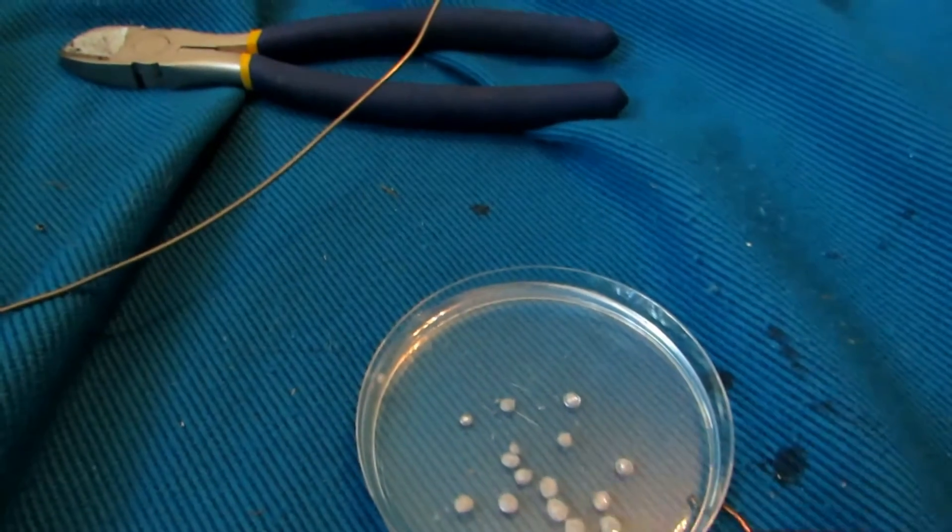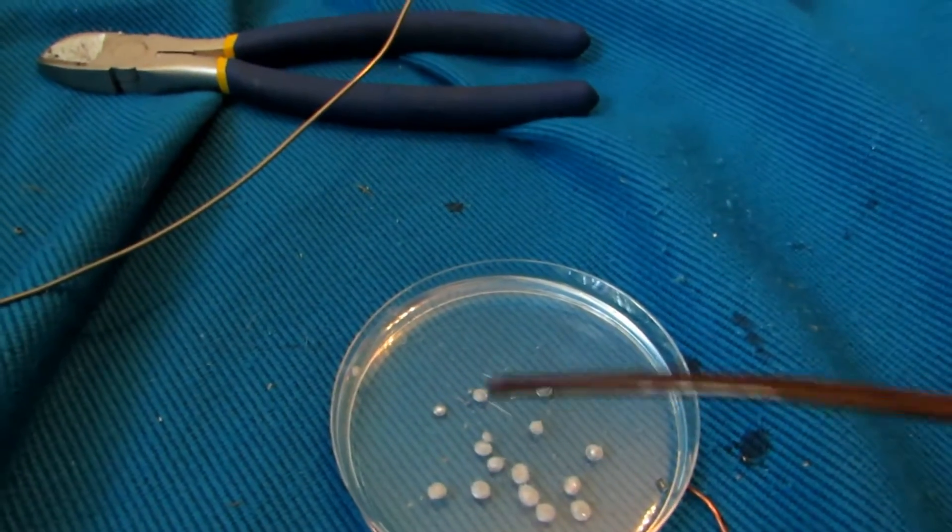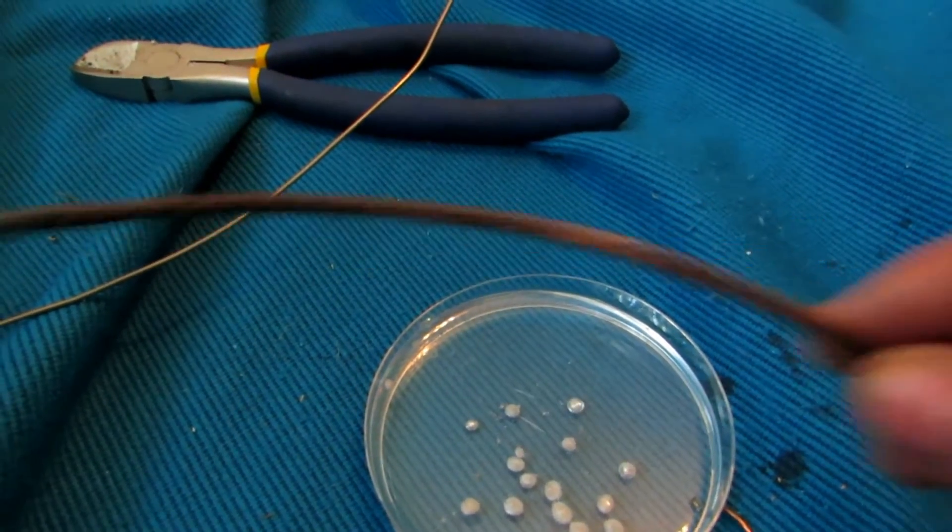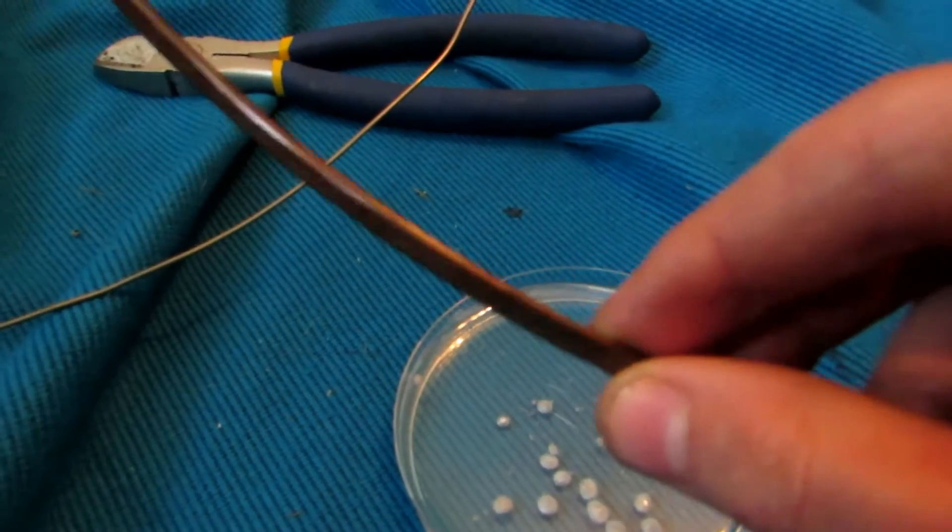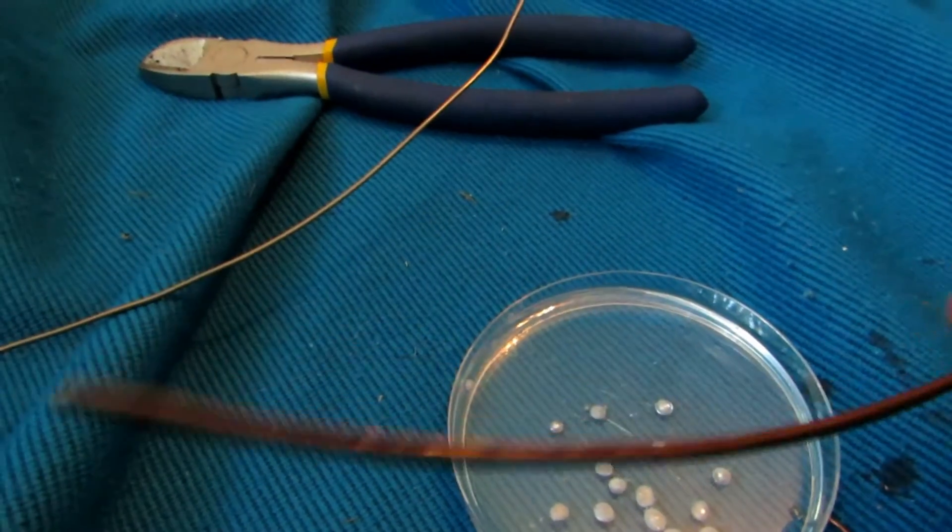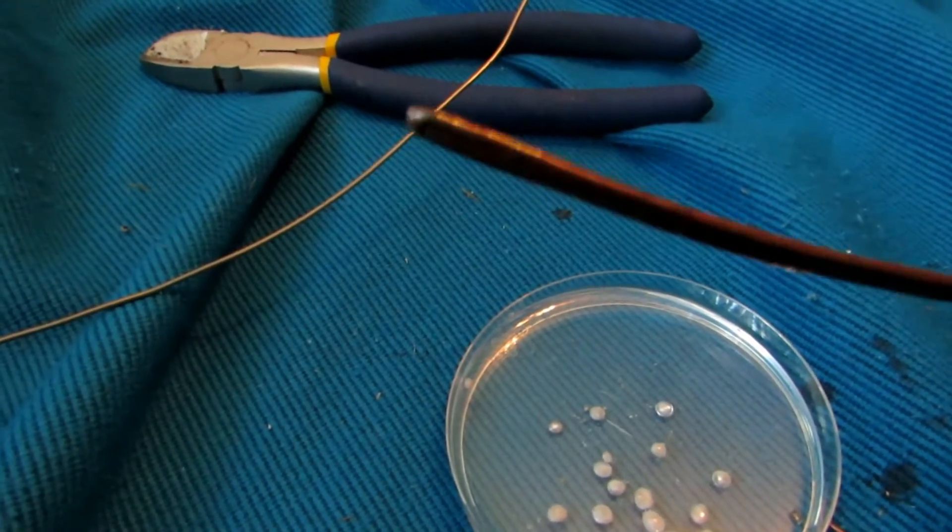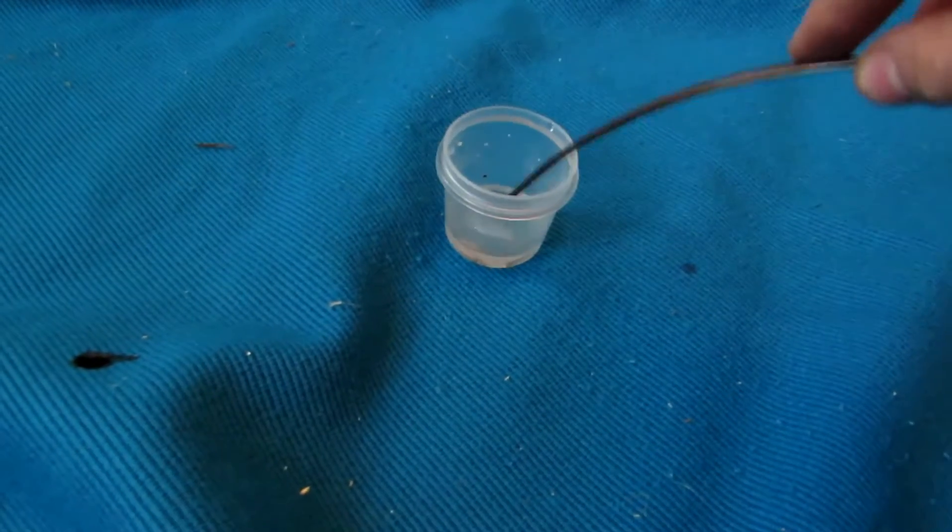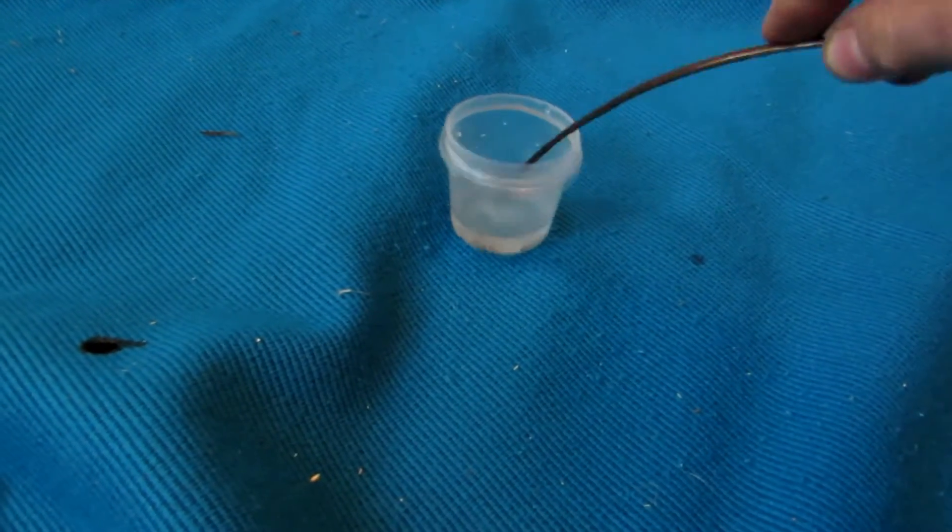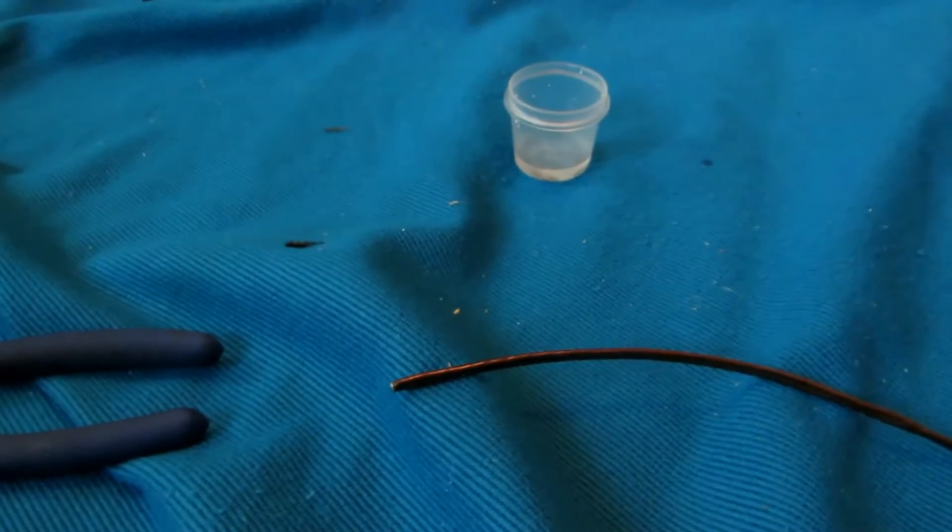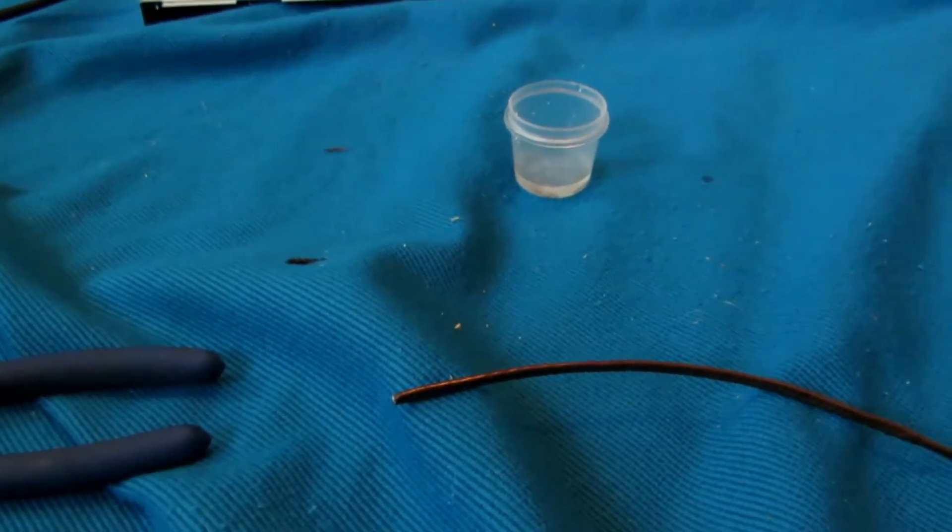Now to show you the reactivity of this, I am going to save this NaK here, but there's still plenty left in this squished tube that I couldn't get out, and I was playing with it earlier just by dipping it in water. Now I'm pretty sure it's all reacted. Yeah, so I'm going to chop this bit and show you again in a moment. I'll be right back.